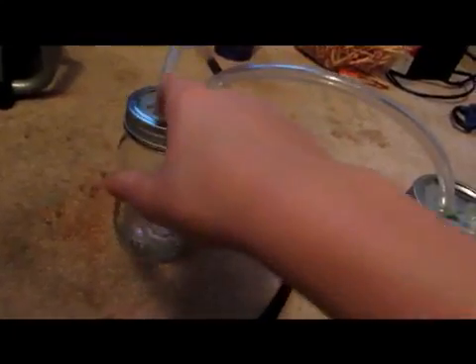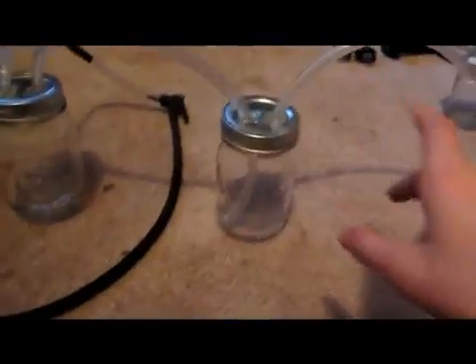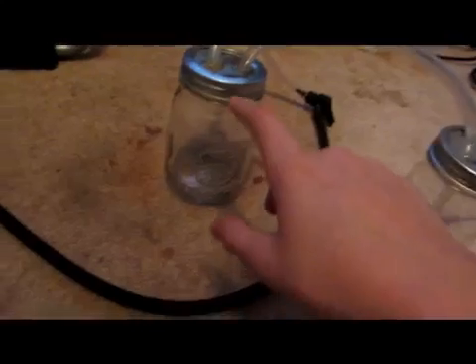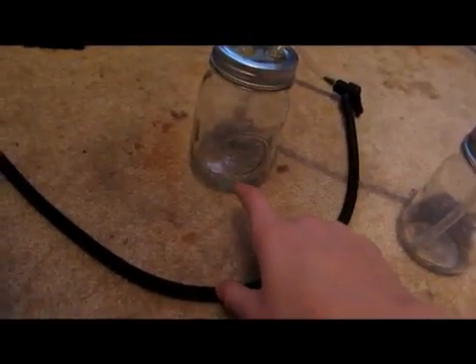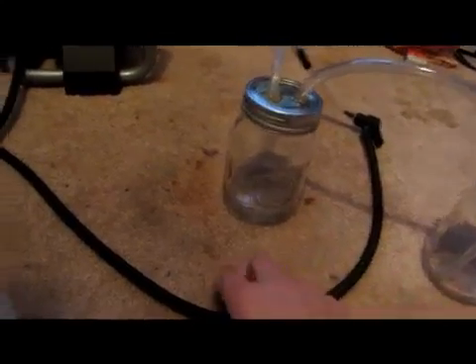Then we're also going to need to build this apparatus. This is pretty simple. I just have two canning jars, and then there's two holes in each of the lids where tubing goes in. This one must go to the bottom. This is where we'll put the hydrogen peroxide, and then an output tube, and then a tube that branches over into here. Neither of these need to go down that deep. And this is where we're going to stick our tin of sulfur in here and burn it.